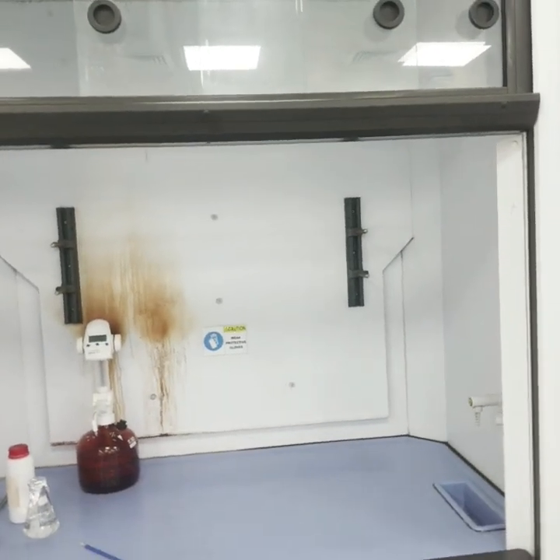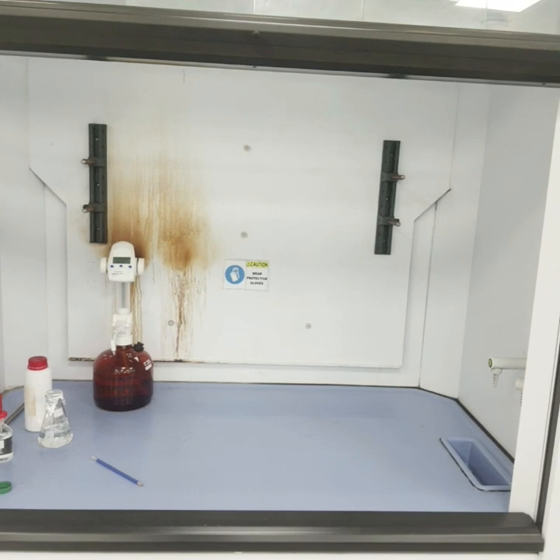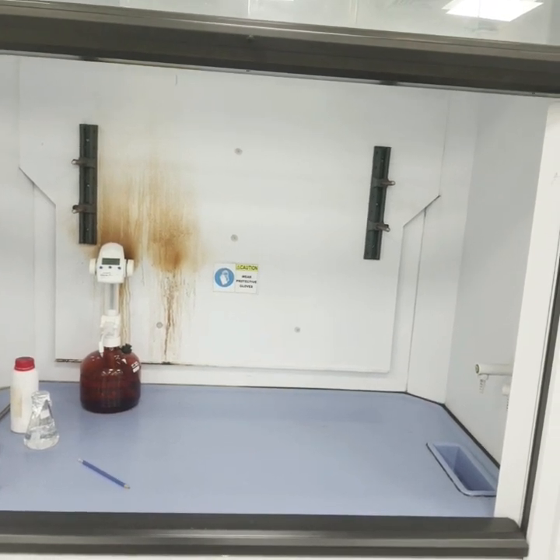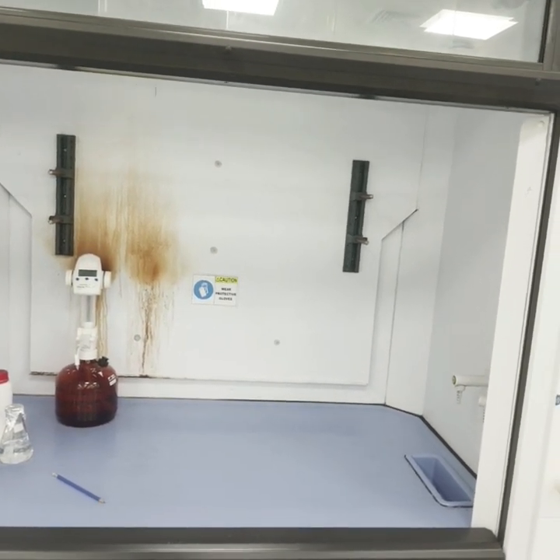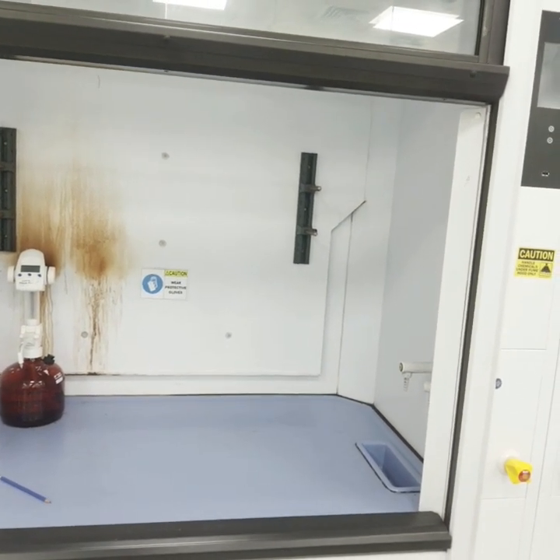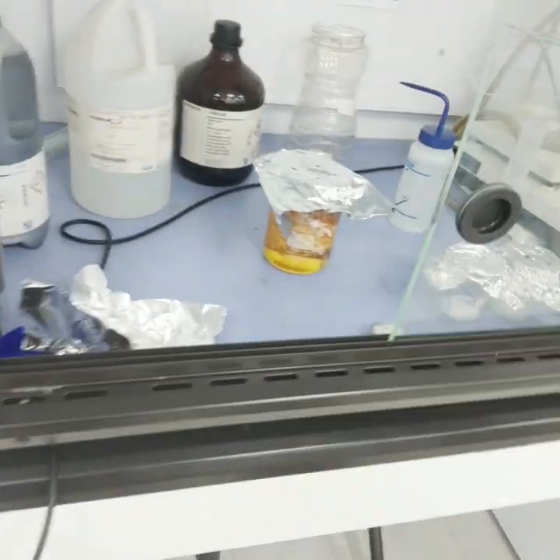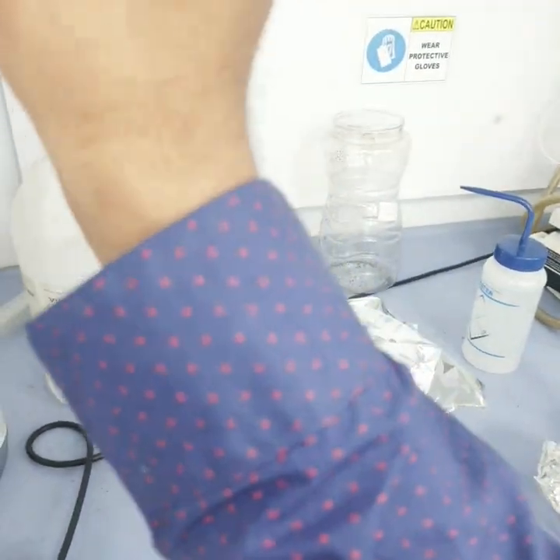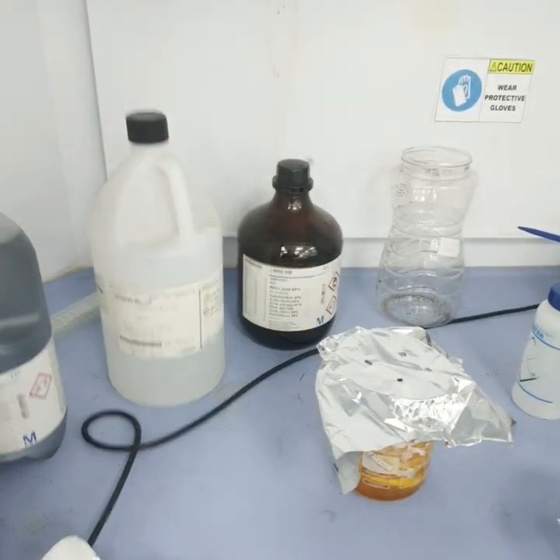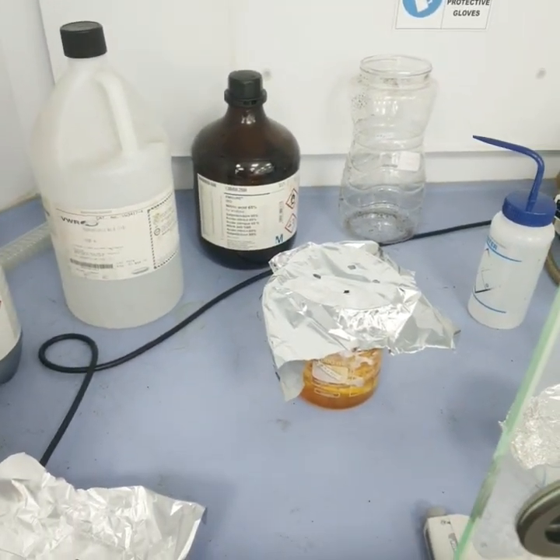The fume hood is also called a fume cupboard or fume closet, and it is a type of local exhaust ventilation device designed to limit exposure to hazardous or toxic fumes, vapors, or dust. For example, highly corrosive acids have toxic vapors, and we can learn about them using the Safety Data Sheet, or SDS.